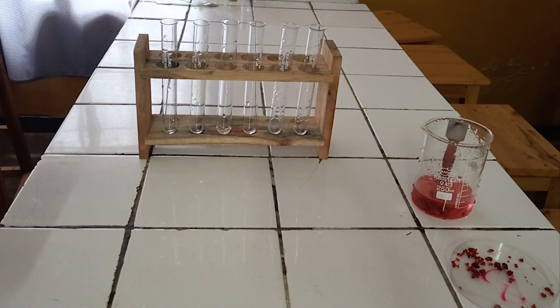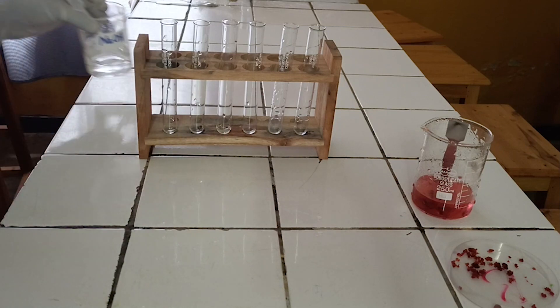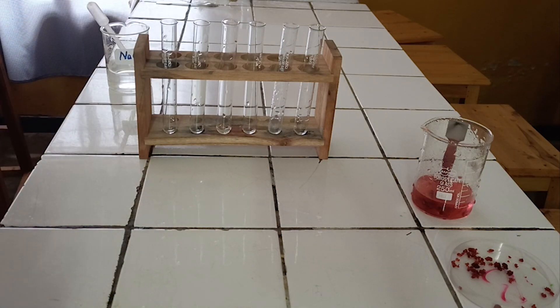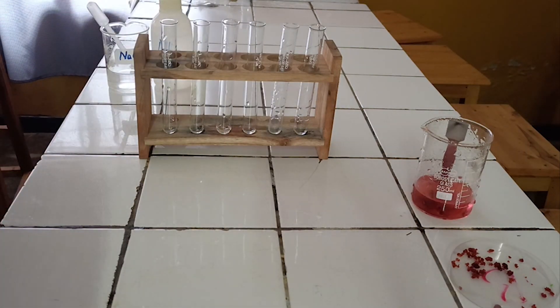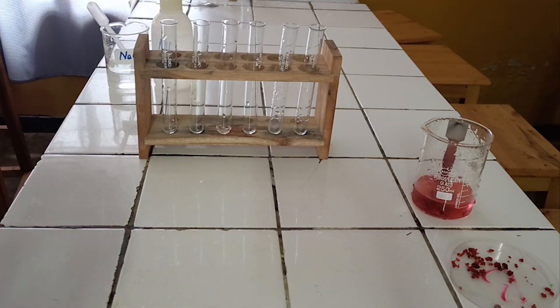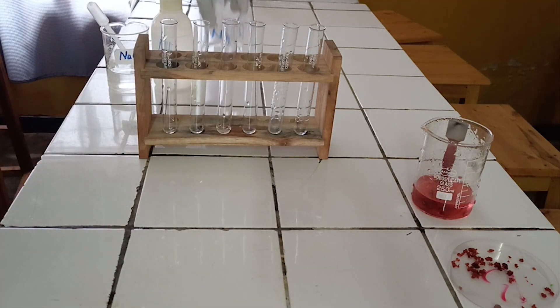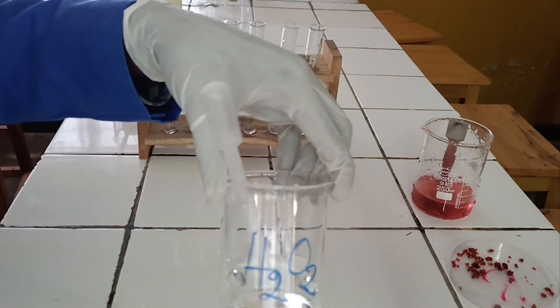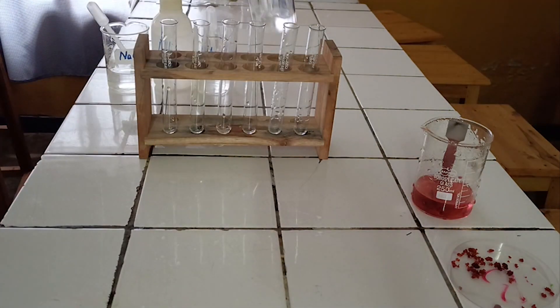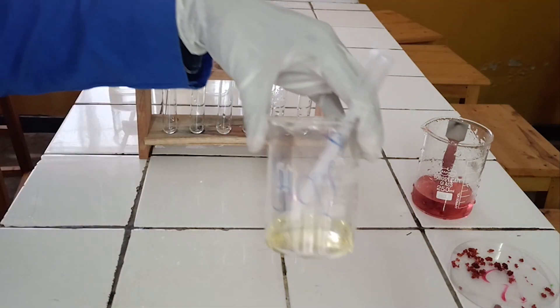Chemicals required: 1. Sodium hydroxide solution. 2. Diluted ammonia. 3. Sodium carbonate solution. 4. Hydrogen peroxide. 5. Concentrated hydrochloric acid.